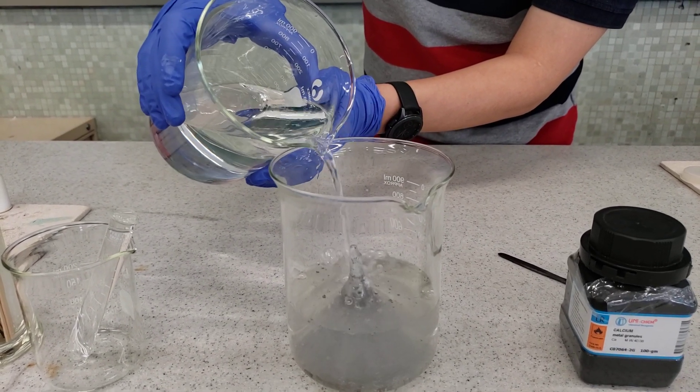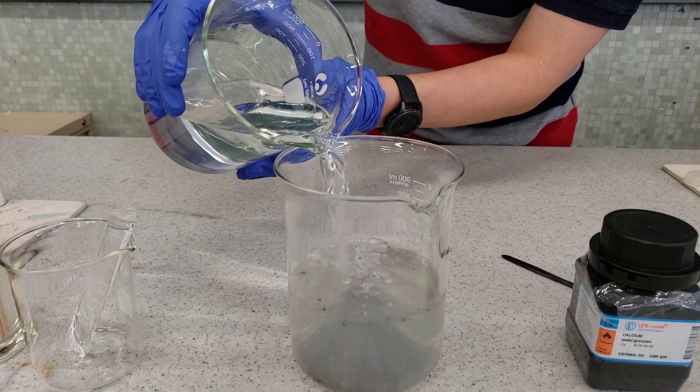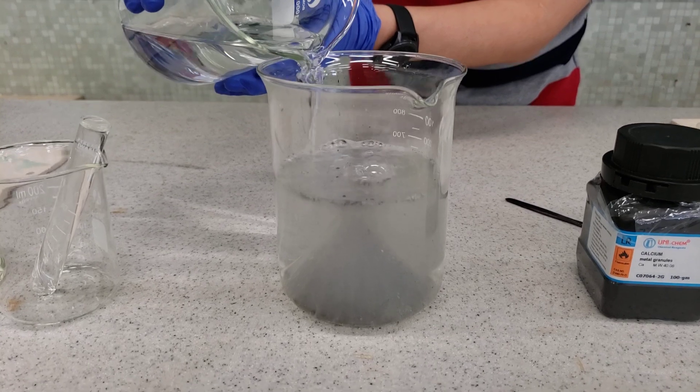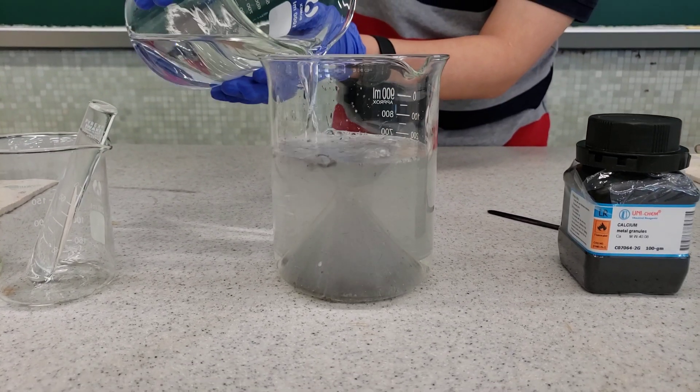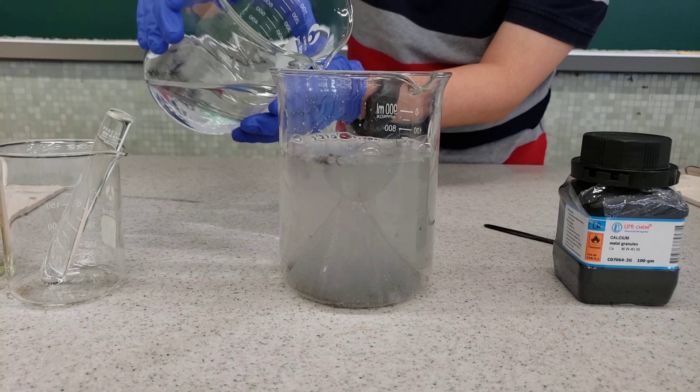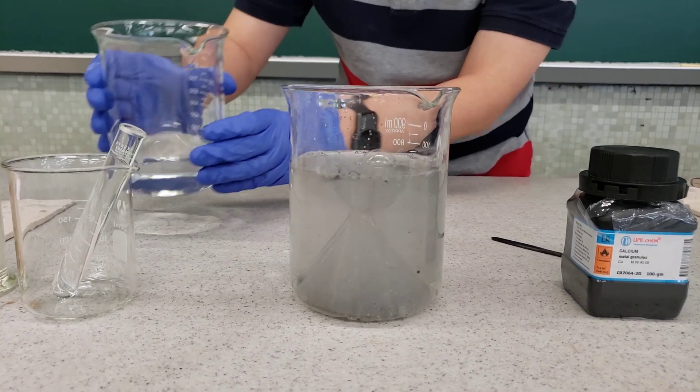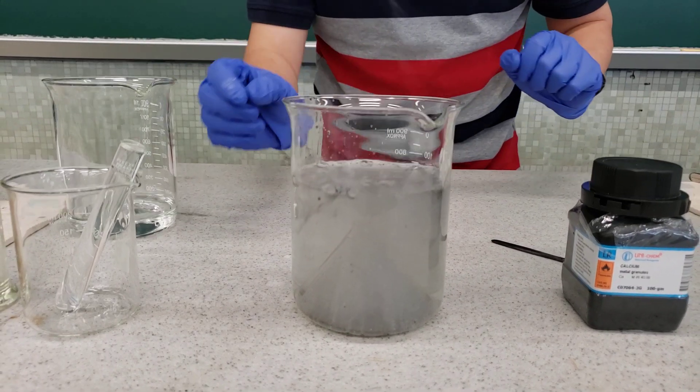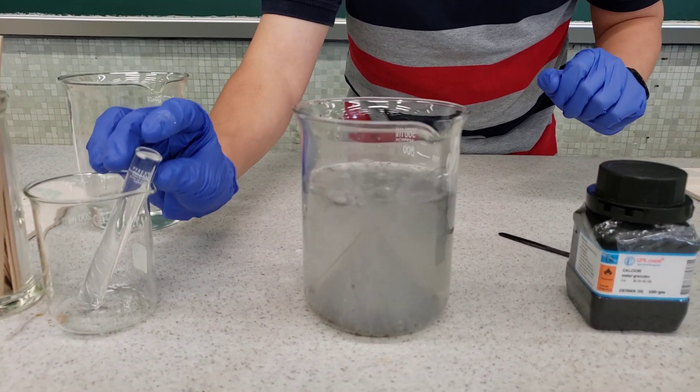Do you notice some reaction take place already? Do you observe some colorless gas bubbles? What is the gas produced? How can I collect the gas produced by this reaction?